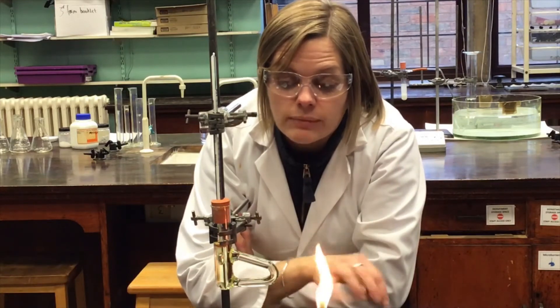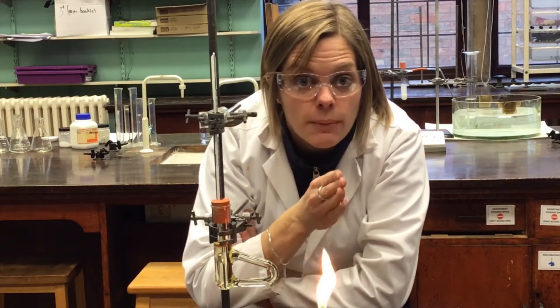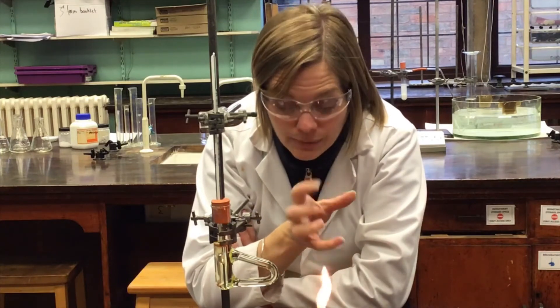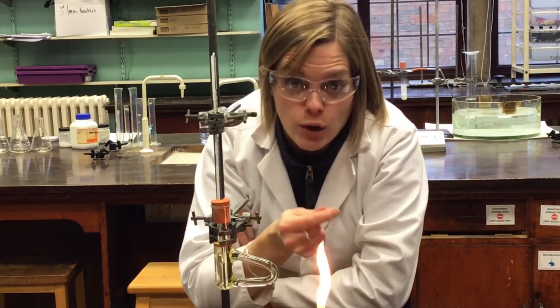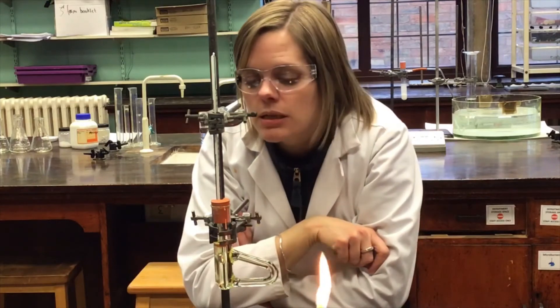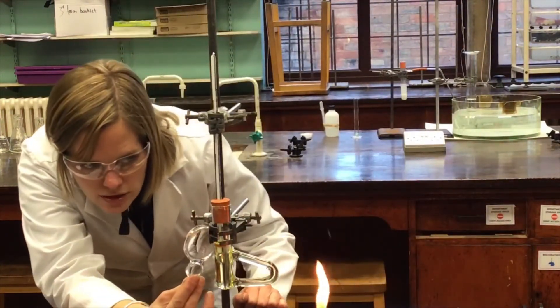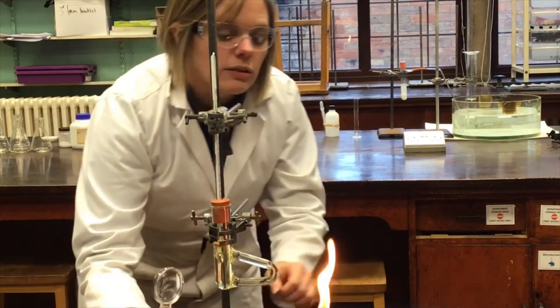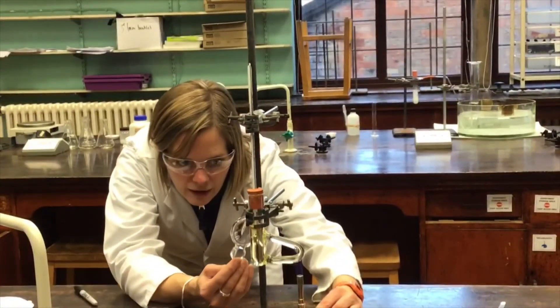The aim for melting point determination is to heat fairly strongly at first, but then when you get close to the suspected melting point, heat really slowly so you can record the start of melting — when the first drop of liquid appears — and the end — when the last crystal disappears. Get that range as narrow and accurate as possible. It's a good idea to have a magnifying glass on standby to keep a closer eye on the crystals.